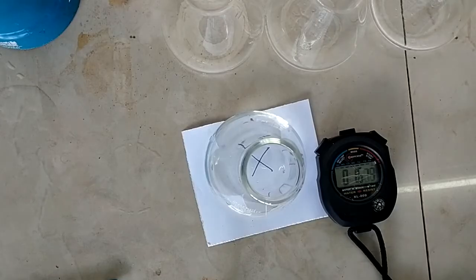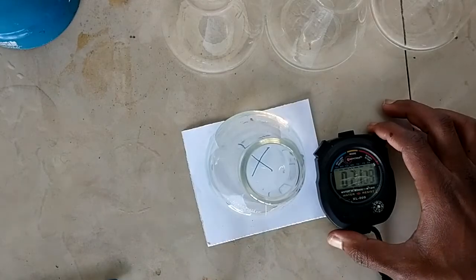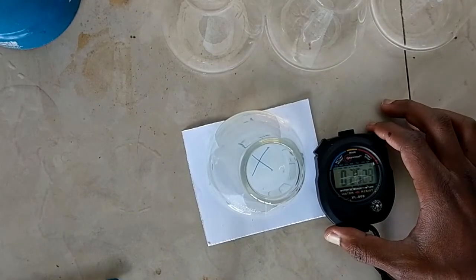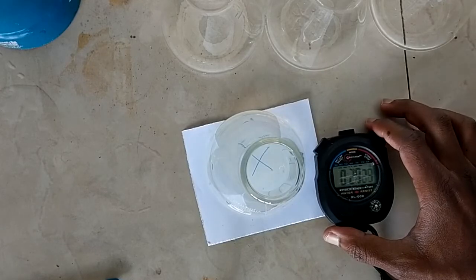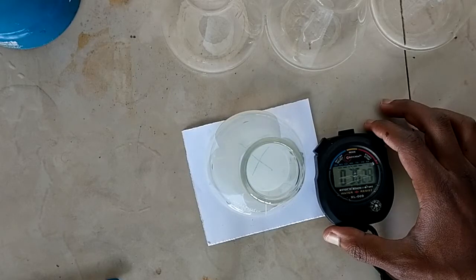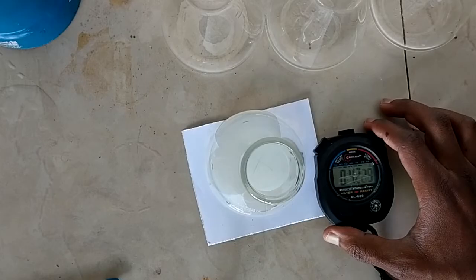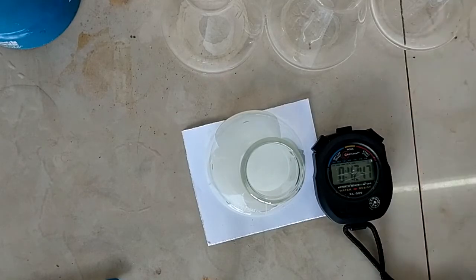So you make sure that you're viewing it from the top not from the side. So there you go. Okay, it must disappear completely and that's it. 42 seconds. So you record that in your data book.